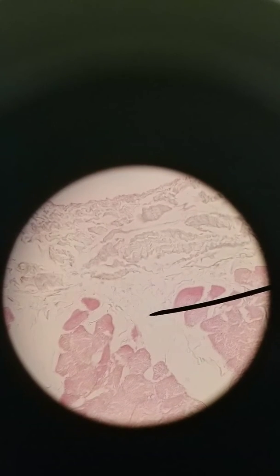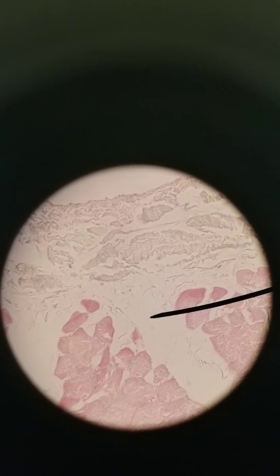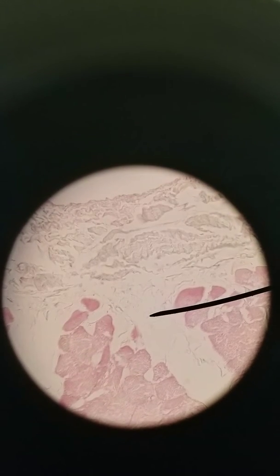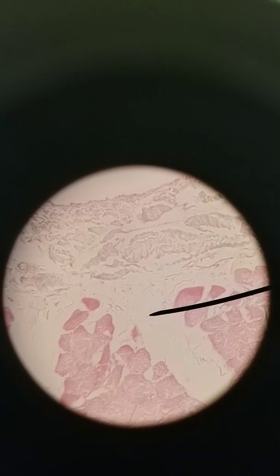All these connective tissues are made of the same thing. They're made of dense, regular connective tissue, and they all combine at the ends of muscles to form tendons, which then fuse to the periosteum of bone, so that when these muscles contract, they can then move bone.